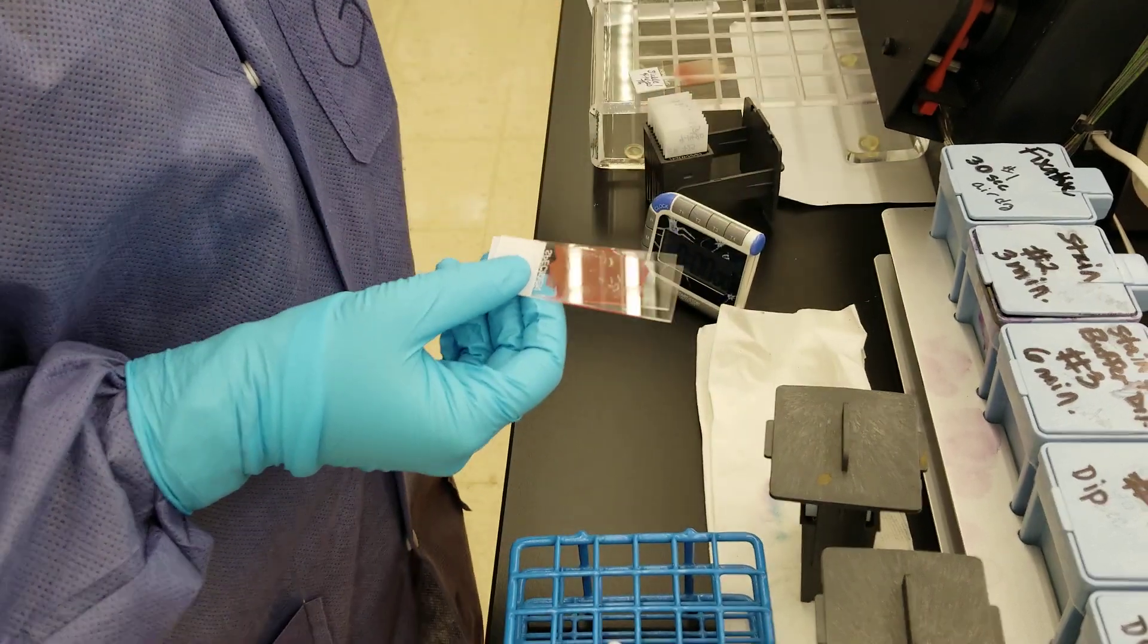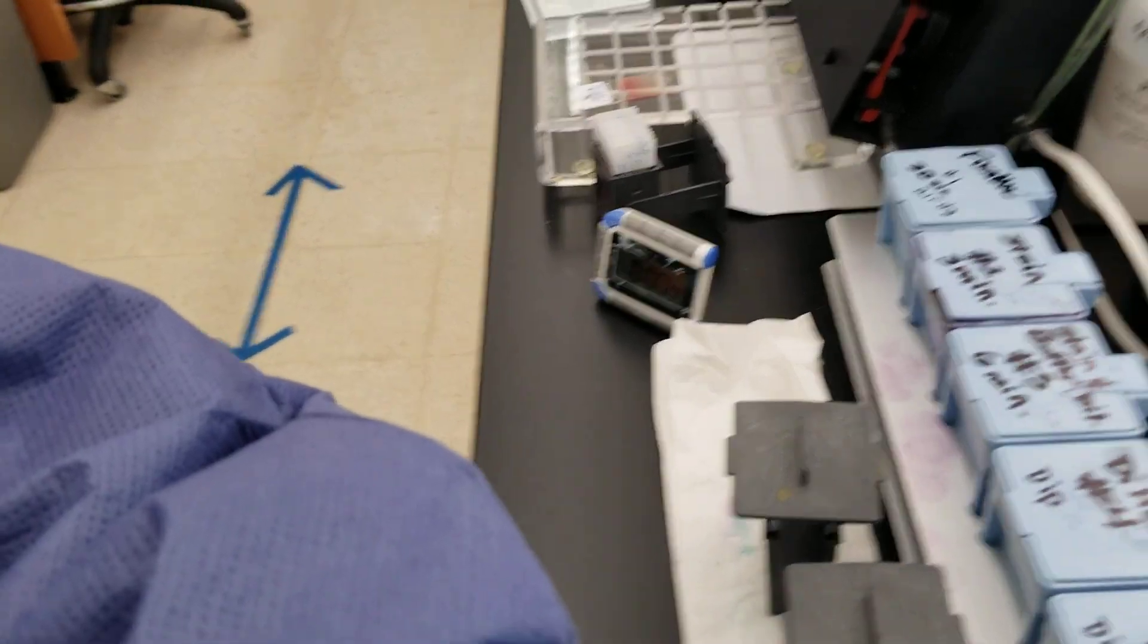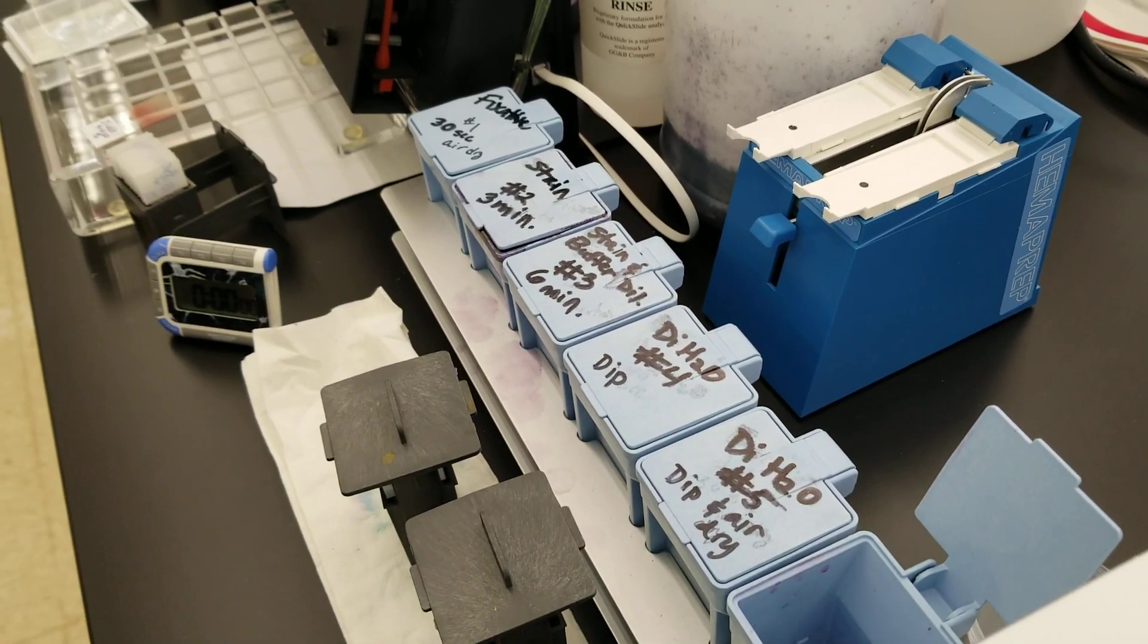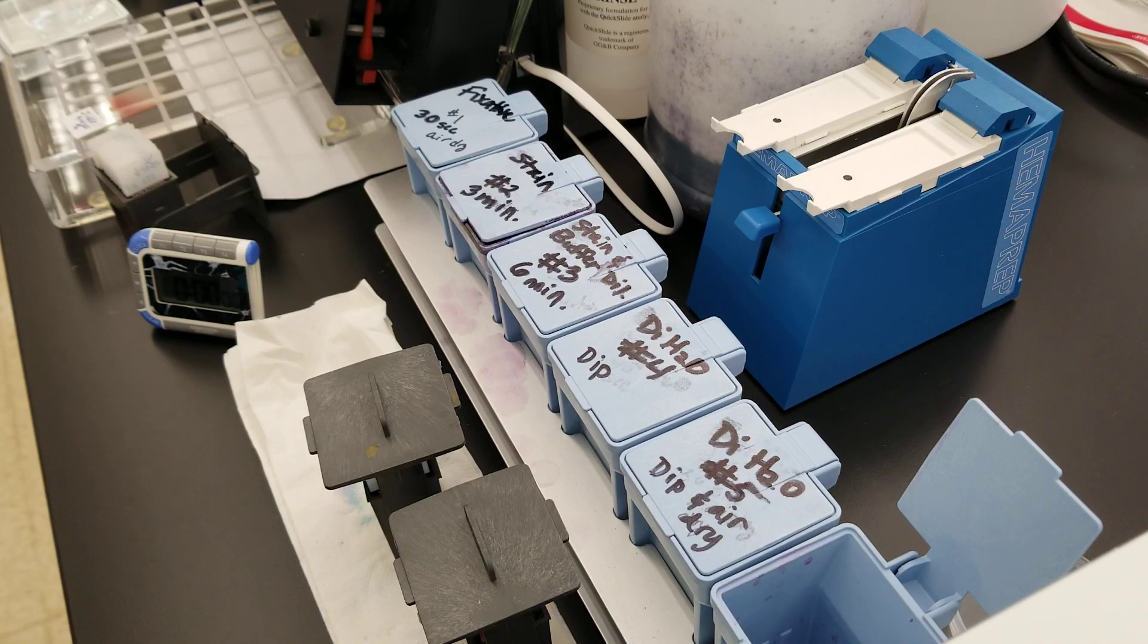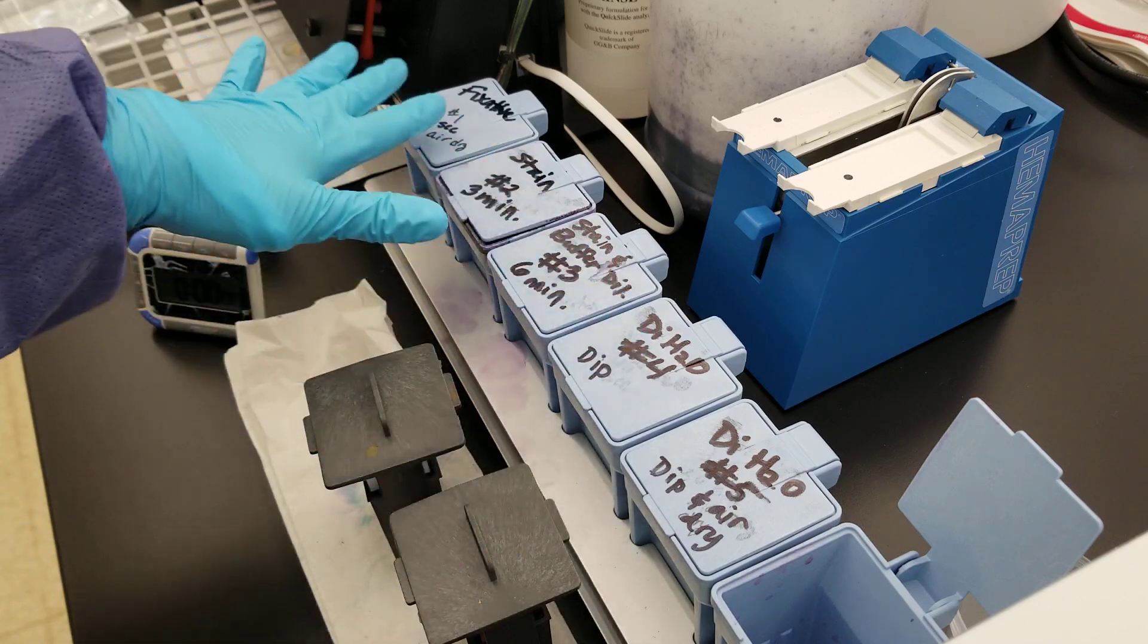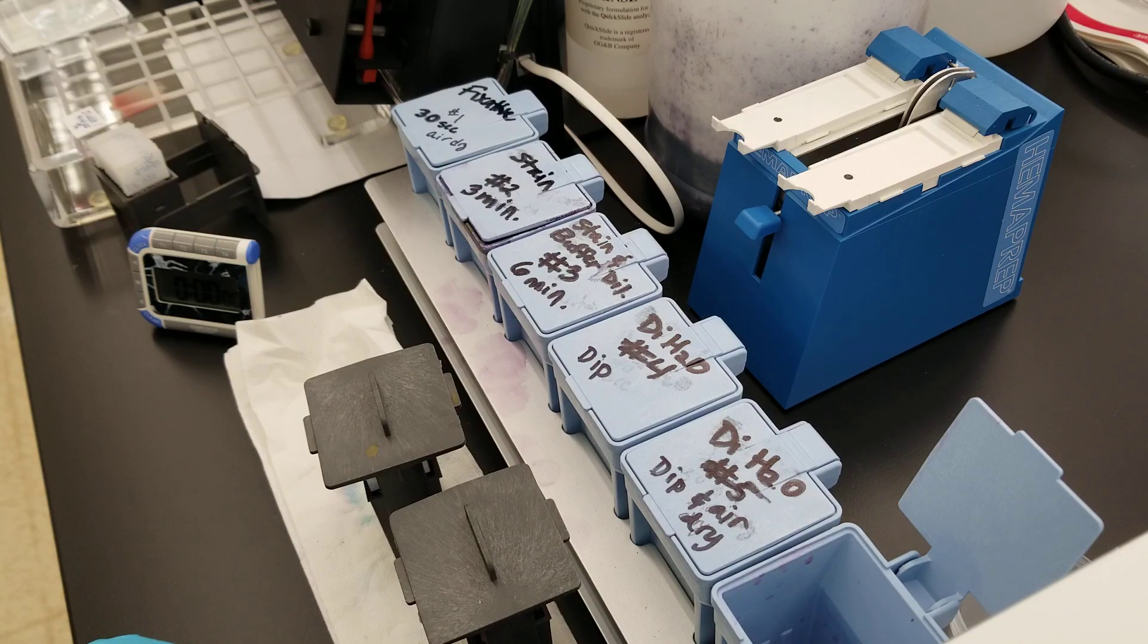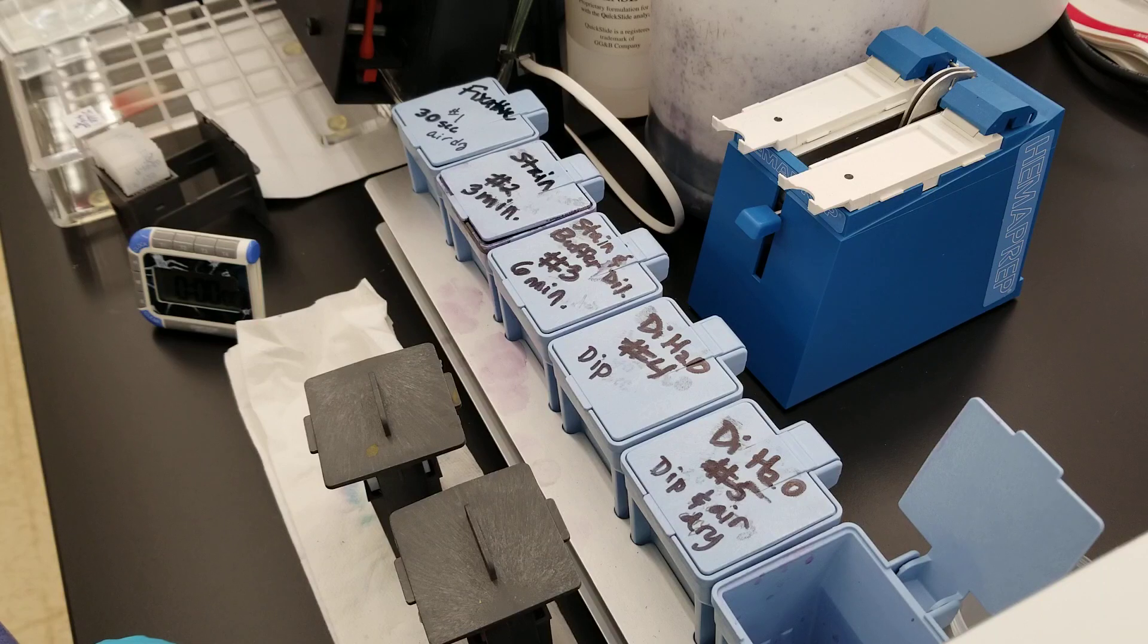We got that part out of the way, just like I promised. Let's move on to the staining procedure itself. We're going to do the manual Wright-Giemsa stain. We have a setup that is on the side of the bottle using that modified version.